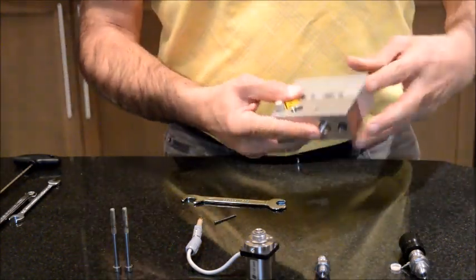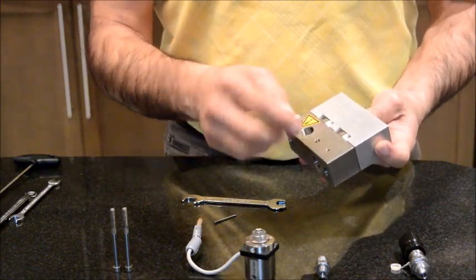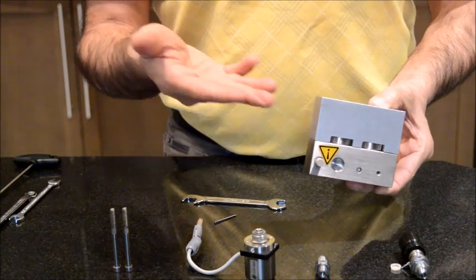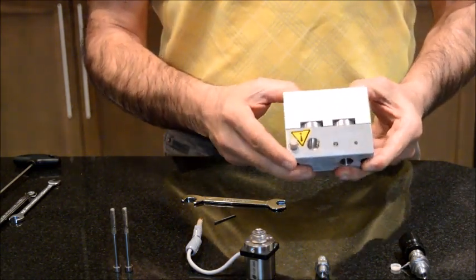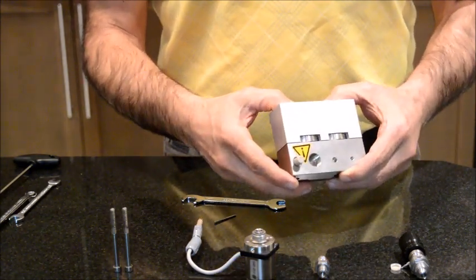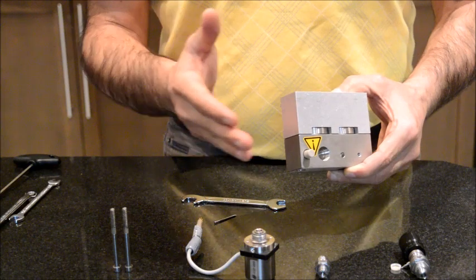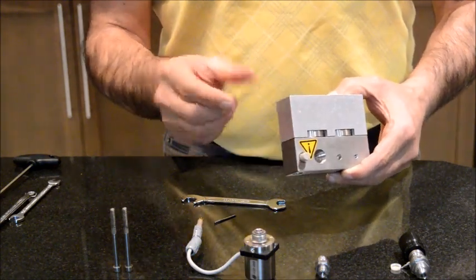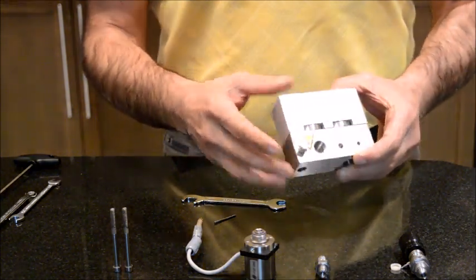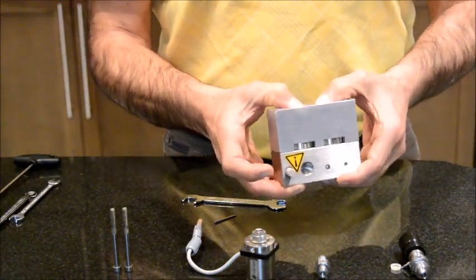Now going back to the pump head, the problems that you may encounter that relate to the pump head itself is leak. Your column starts to leak, or the pump starts to leak. Sometimes the leak is so severe that the system shuts down. Sometimes the leak is not that severe, but you notice that your peaks in the chromatography start to shift. Maybe you have two peaks that are eluting close to each other, but you start losing the resolution, and all these problems. To resolve this issue, you have to replace the pump seals.